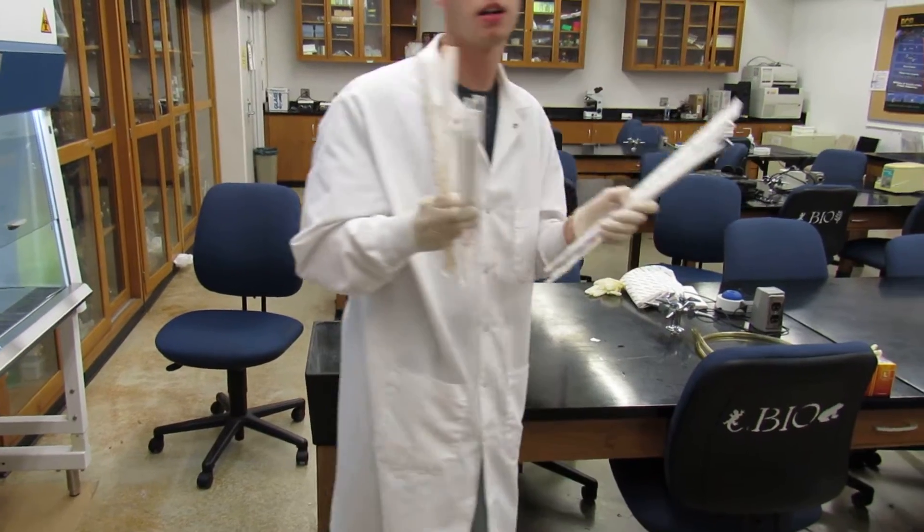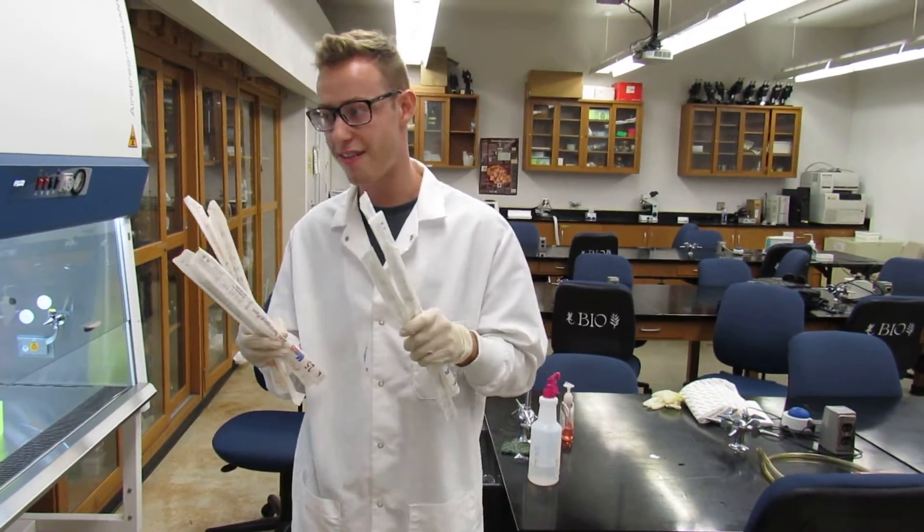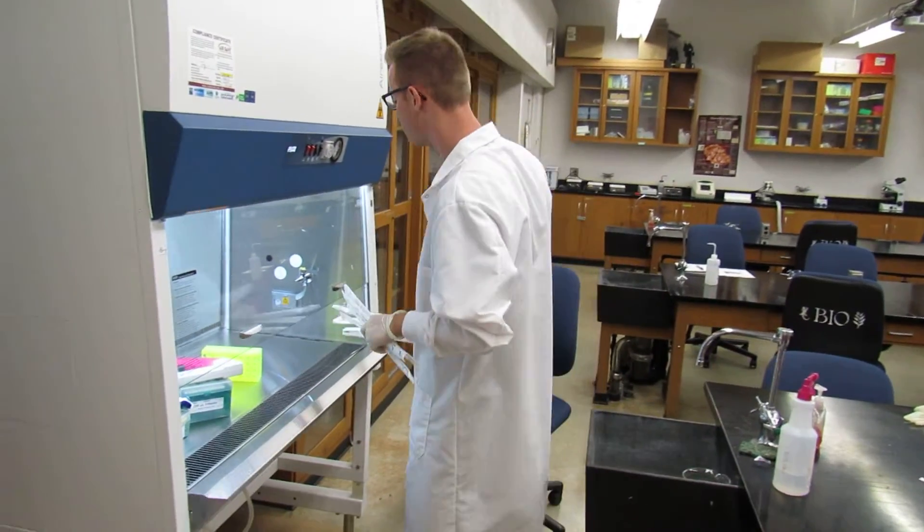You will want to grab serological pipette tips, a 5ml, a 10ml, and a 25ml, and you will place this inside your biosafety cabinet.